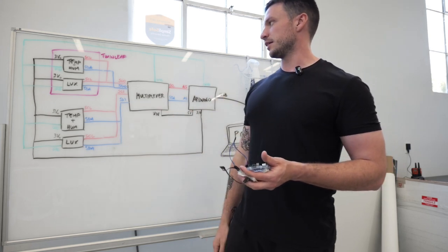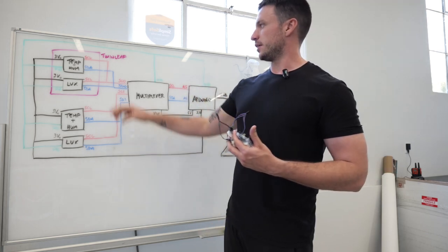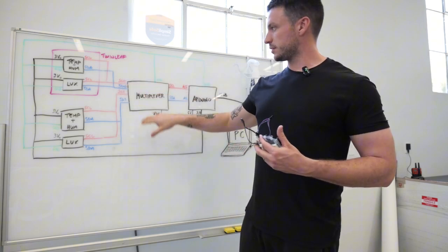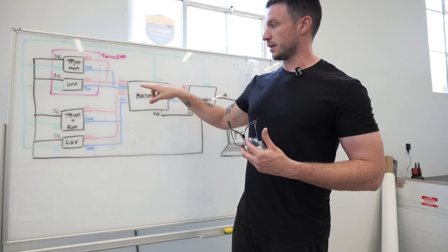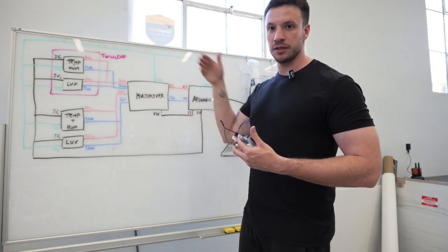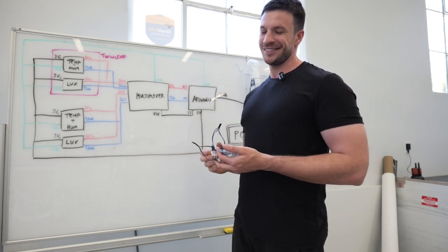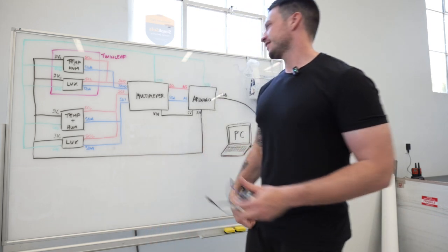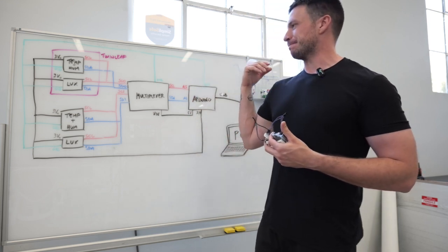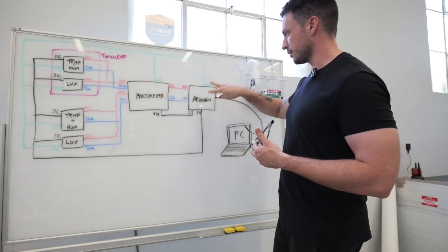And the idea is that these sensors have an I2C connection, and so I have these SCL and SDA channels that will go into the multiplexer, and there are multiple inputs for the SCL and SDA in the multiplexer, and basically the multiplexer will read out sequentially all of those, and so you can have a pretty much simultaneous, there's no such thing as simultaneous in physics, but we can say that pretty much at the same time we can read out the temperature, humidity, and light in two different environments using the multiplexer and connecting that to the Arduino.